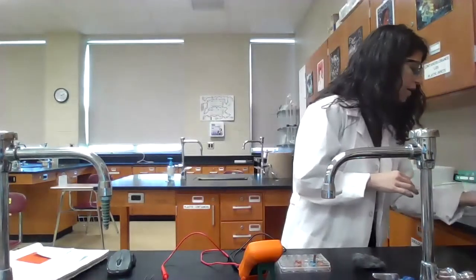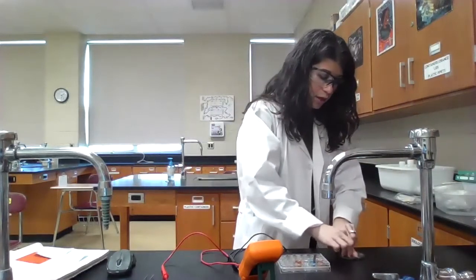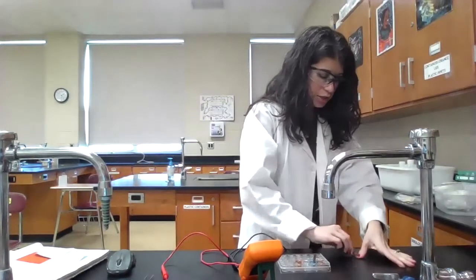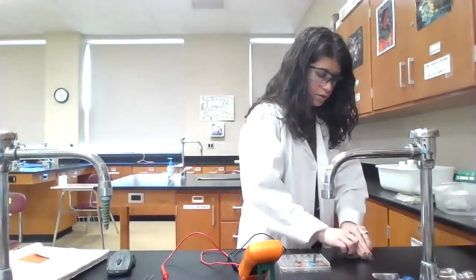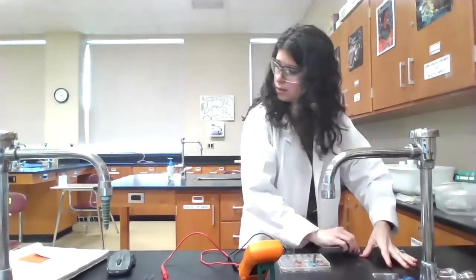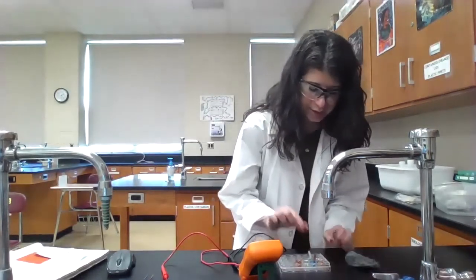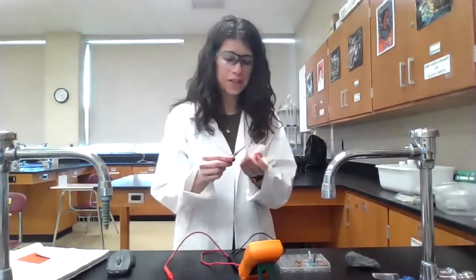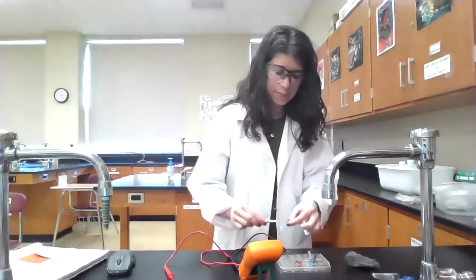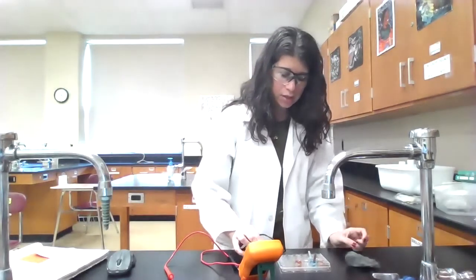And then I'm going to take my piece of zinc metal here. I'm going to do the same thing. I'm going to clean off any of the oxidation that may have occurred. And then I'm going to put this one into the zinc well there. And then I'm going to take my piece of filter paper, and I just have some tweezers here for when I dip it in. I'm just dipping it into potassium nitrate because, again, that's serving as my salt bridge.